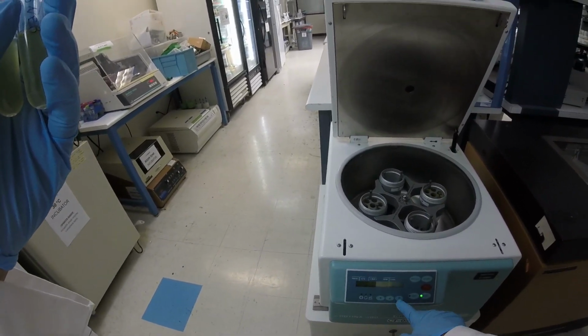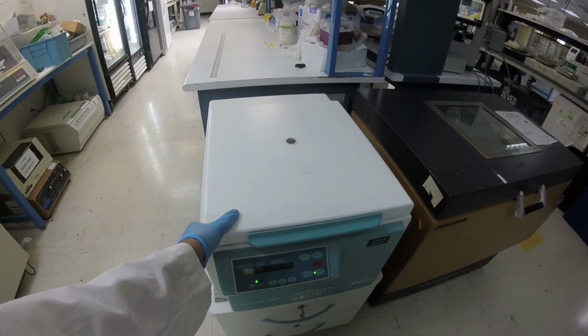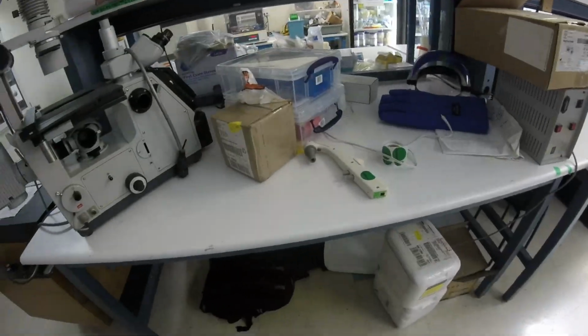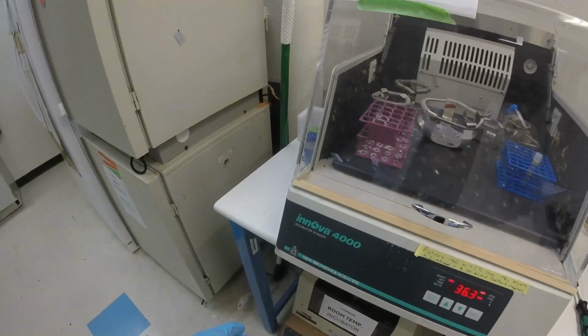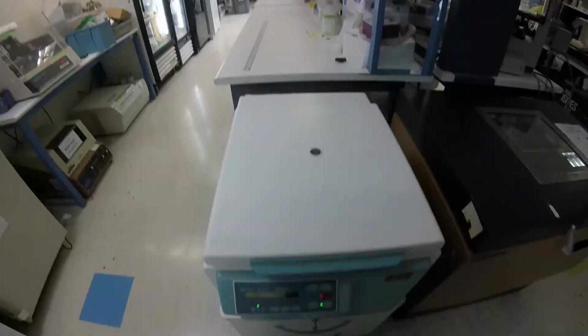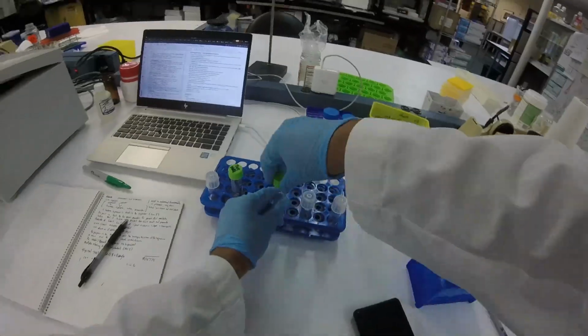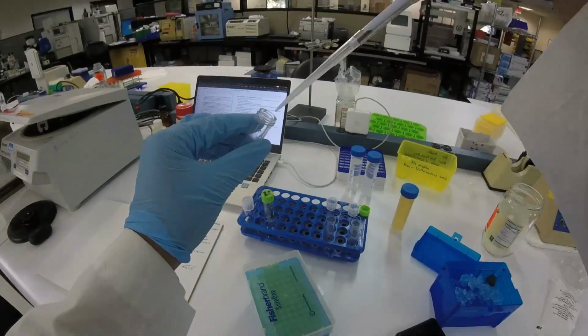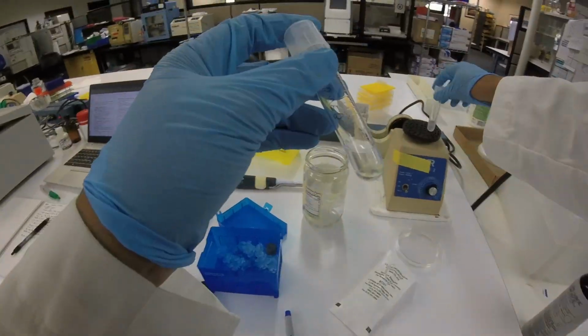Anyways, the whole thing about making them competent is you don't want any ions in that solution, because if there's ions and it conducts, you're going to get an arc and the solution is going to boil and destroy everything. All of the cells will die, and you're not going to have a successful transformation. So the procedure of making the cells electrocompetent is you take your original solution that's in lysogeny broth medium, which is very ion rich, has tons of salt and other stuff that's going to conduct electricity, and you wash it out.